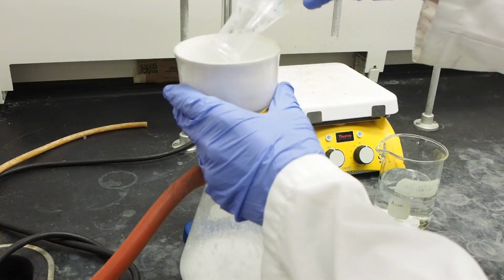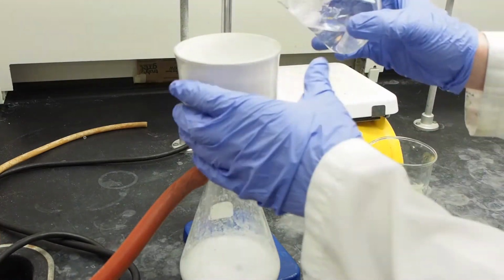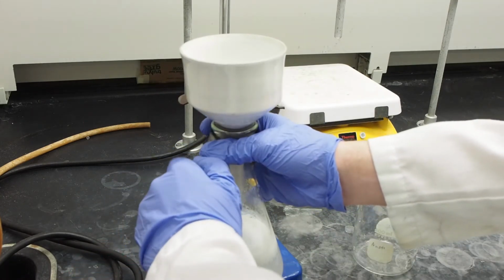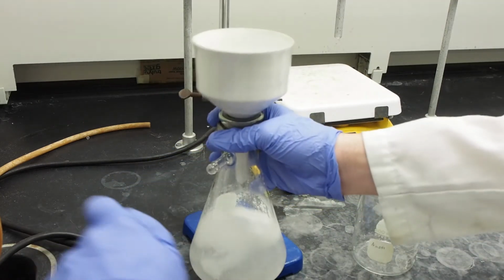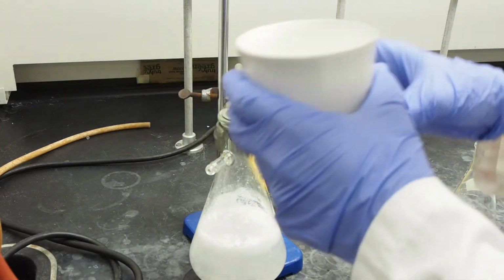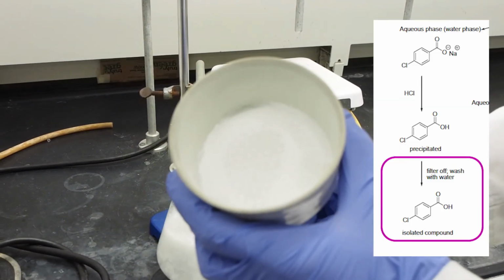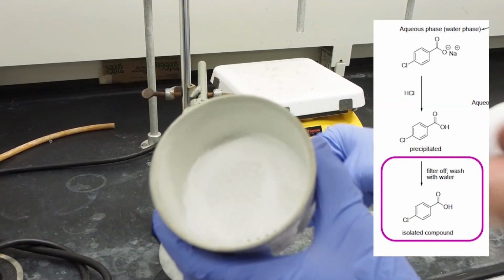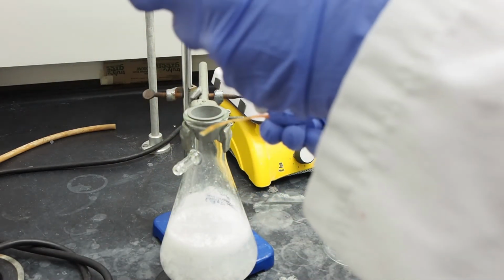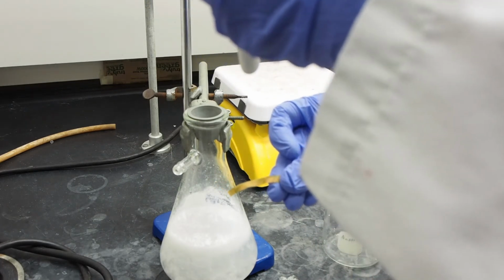After all the acid is precipitated, perform vacuum filtration and wash the crystals with plenty of chilled water to remove the remaining hydrochloric acid. You may check the pH of the solution coming out of the funnel. While the vacuum is still on, pull the hose off the filtration flask, take the funnel, and touch the stem of the funnel with the pH paper to verify that the solution is neutral. When finished, leave it for 15 minutes with the vacuum on for drying.